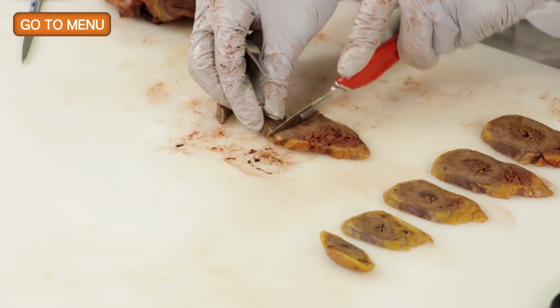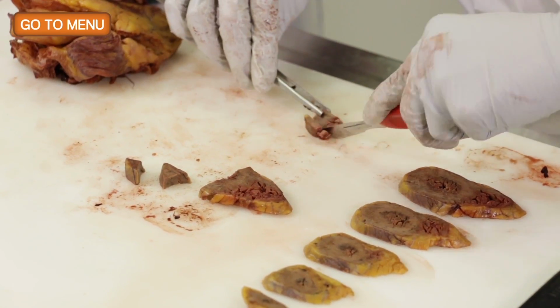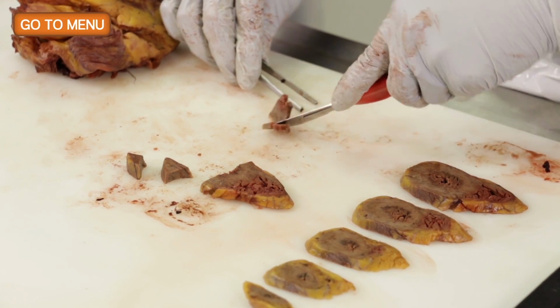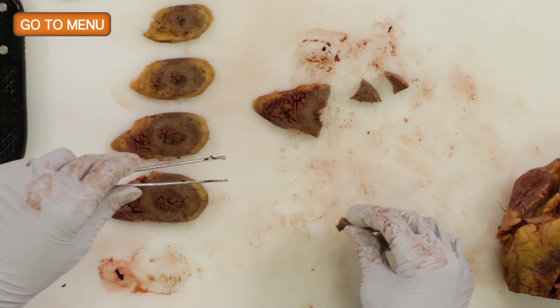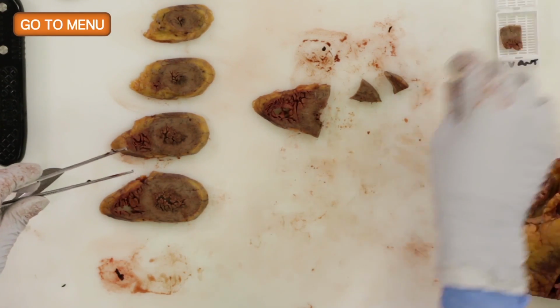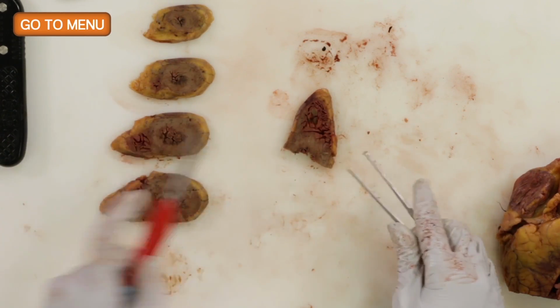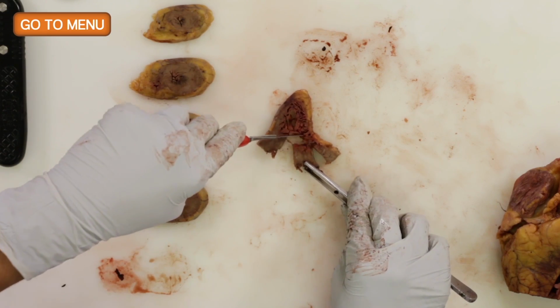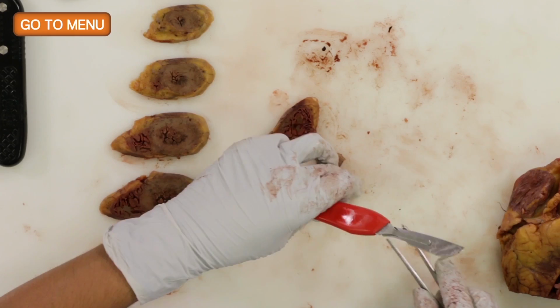And now we're getting the anterior. And this way, if there are any surprises, maybe there's global ischemia or myocarditis or something like that, we'll pick it up and know what part of the heart it's involving. Anterior, and then septal. Of course, if there are focal lesions, something that looks like an acute or chronic infarct, then you want to sample those in addition.